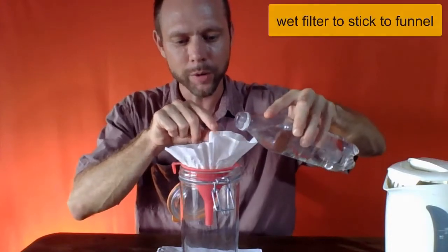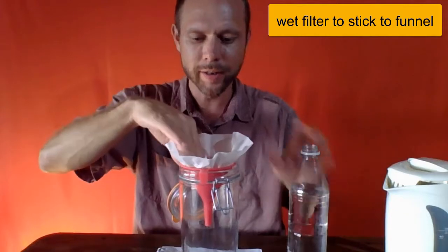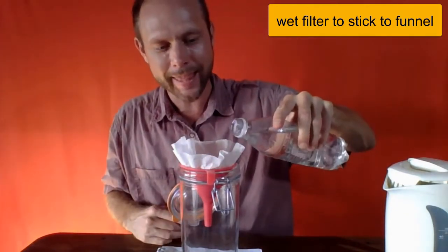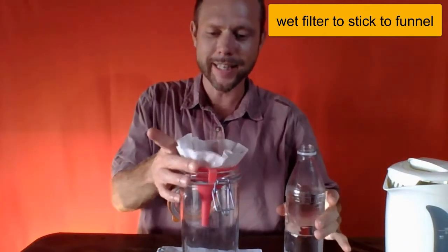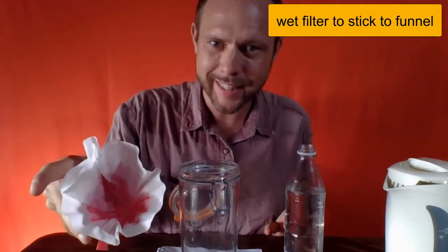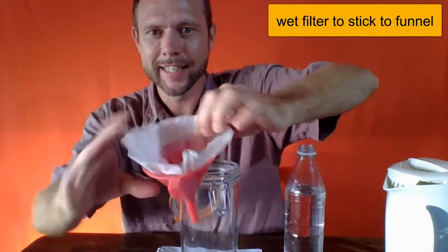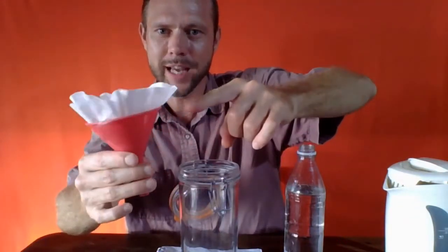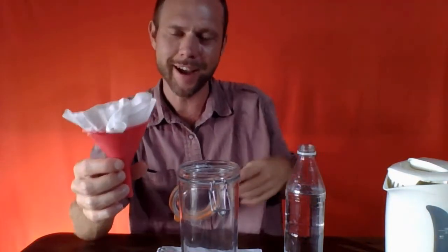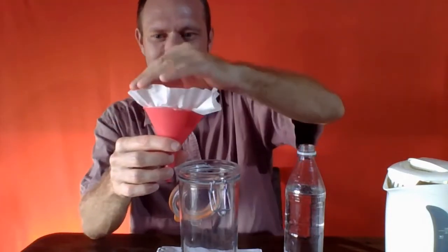And now we're going to pour just a slight amount of water onto this filter paper. I'm not filtering anything, but rather I'm just trying to get the paper a little bit wet so that it's going to stick cleanly to the sides. You can see how the paper is up above the funnel level, right? It's pretty easy to get the paper down inside the funnel, and then the sand is going to go up over the paper and down the funnel, and that's not what we want.